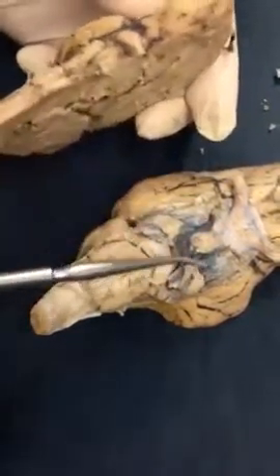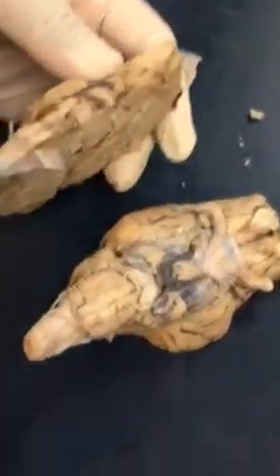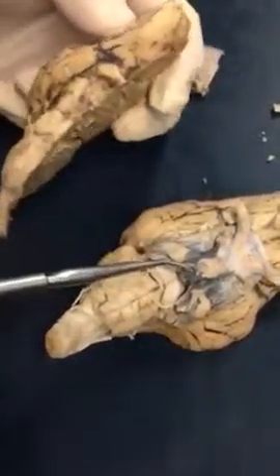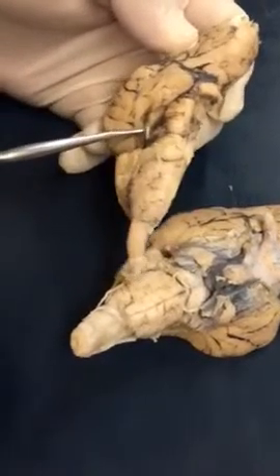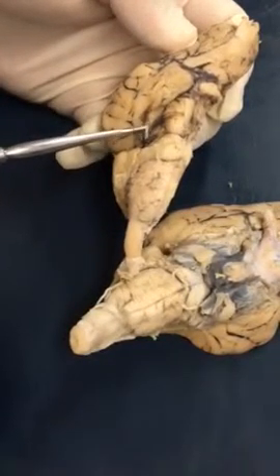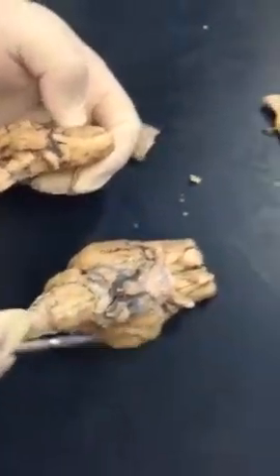So on this view, we took this whole thing off. That's what this is right here. So we took the pituitary and trigeminal off. Deep to that, you see the oculomotor. And on this one, you actually see the trochlear nerve as well. So those are the ones you definitely want to be able to recognize on the sheep brain.